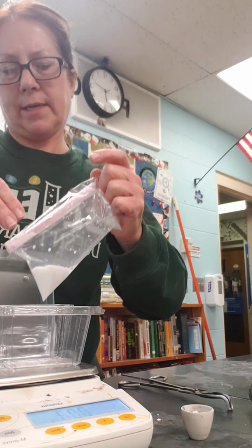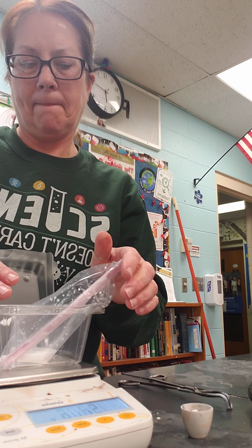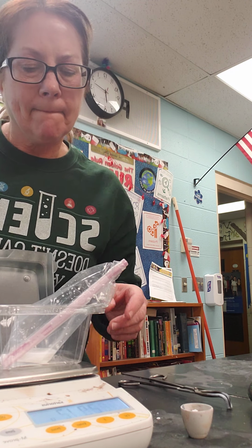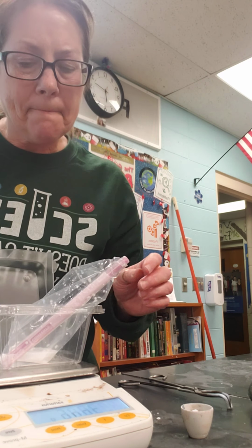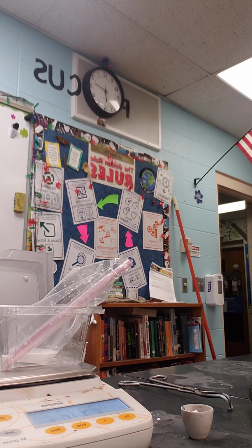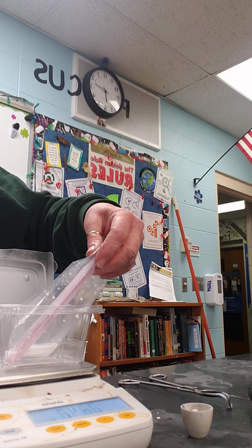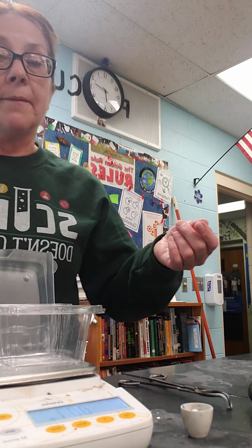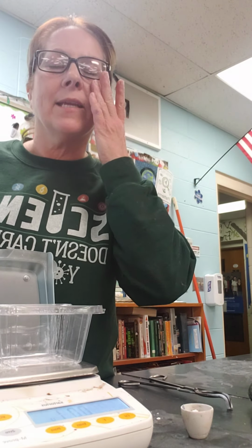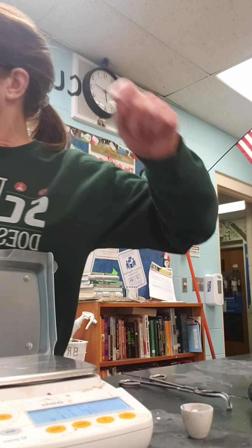I think I'm done reacting. Get that stuff down there. Okay. I've got 29.13. Okay, now I'm going to write that down on our data table, and you can, oh, nope, I got to do this one too. Let me write that down.